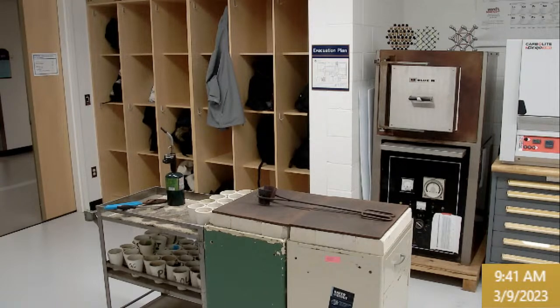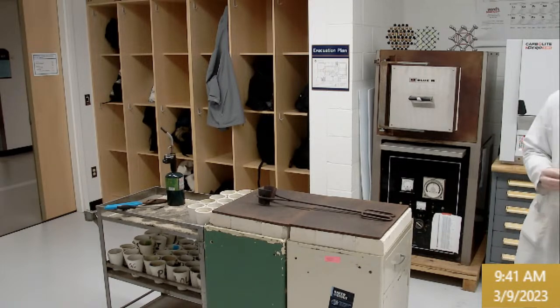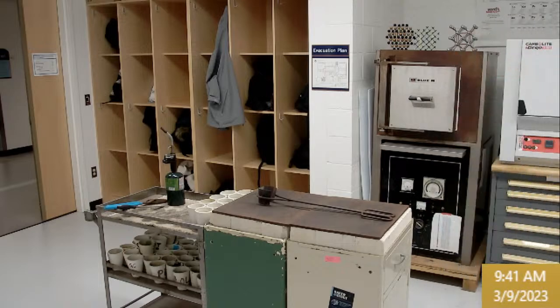So for that one, you have this piece of glass sitting there. You also probably will want to wear a glove because the radiant heat is significant. And then you will stamp about in the bottom centimeter of that glass disc, and you just kind of push it in, sort of like you're making a seal in hot wax. It just kind of sinks in a little bit. You don't have to push too hard, but just sink it in the glass a little bit.